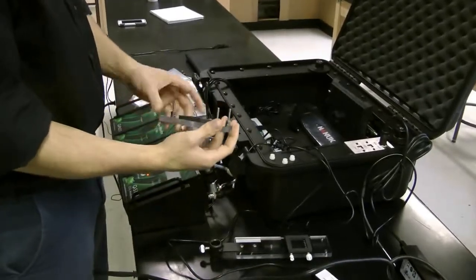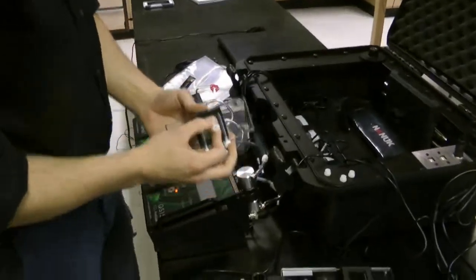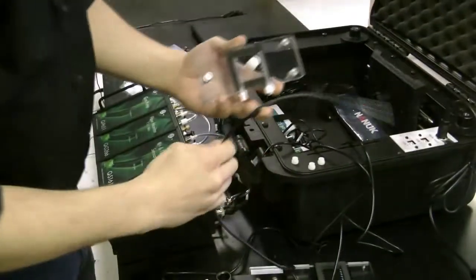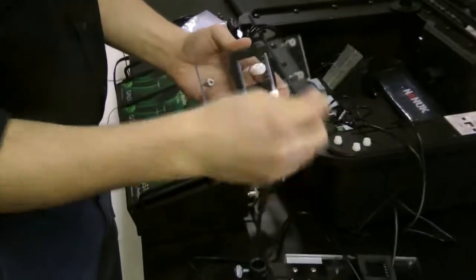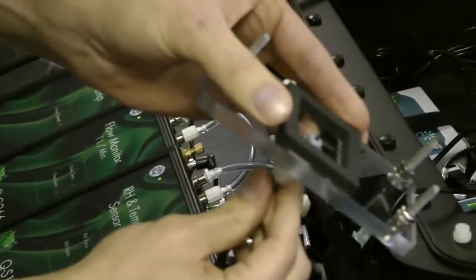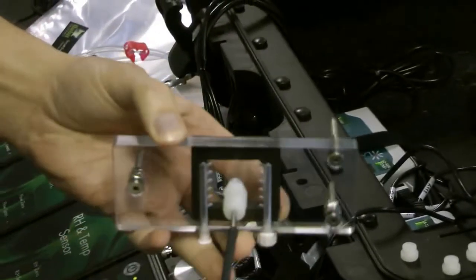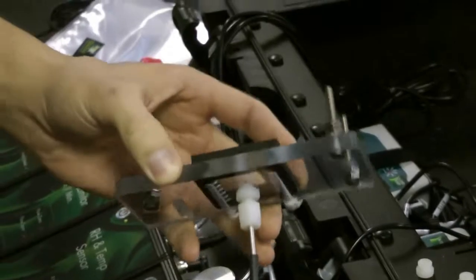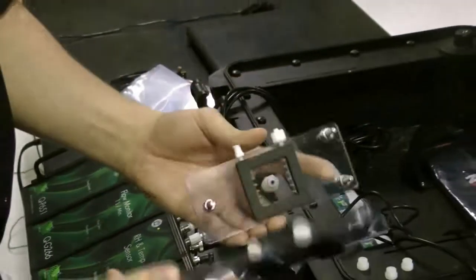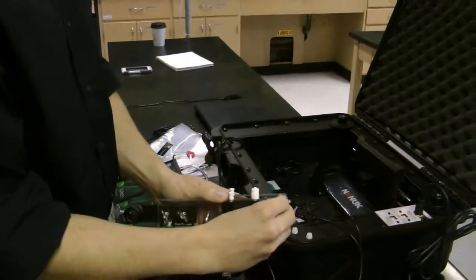Looking at the bottom of your flow-through leaf chamber, you can see that there's a small Swagelok fitting. This is used for your temperature probe. Simply loosen it a bit, take your probe, and insert it so that it just goes through and is inside the enclosed part of your chamber. Tighten the fitting so that the temperature probe won't become loose and disconnect while your experiments are running. Reconnect the flow-through chamber, again using the thumb screws.